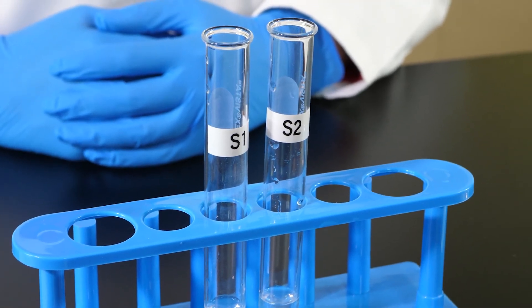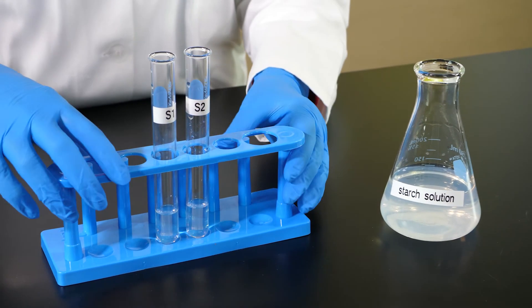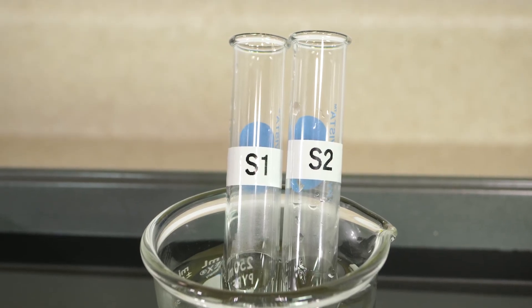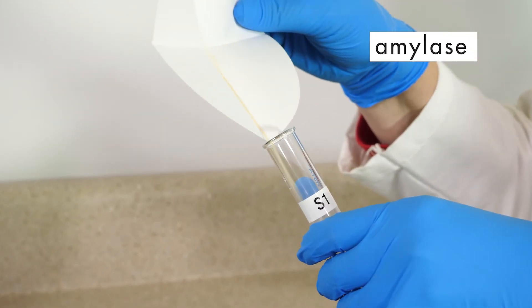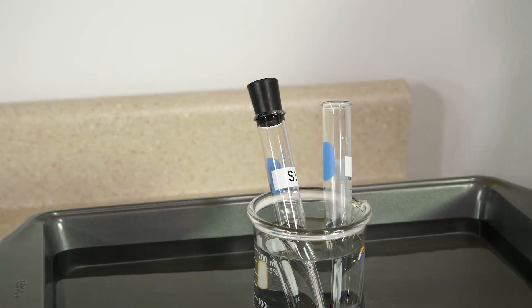5 ml of a starch solution have been added to each of 2 test tubes. Each test tube has been marked with an S for starch digestion and labeled S1 and S2. Both test tubes are placed in a water bath at 100 degrees Fahrenheit or 38 degrees Celsius. The test tubes remain in the water bath for 15 minutes. Next, we take test tube S1 out of the water bath and add 0.15 grams of amylase to the starch solution, then mix the contents and place the test tube back into the water bath. Test tube S2 contains the starch solution, but no enzymes will be added because this is our control. The test tubes remain in the water bath for another 10 minutes.